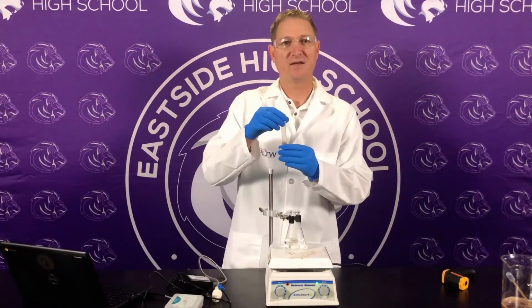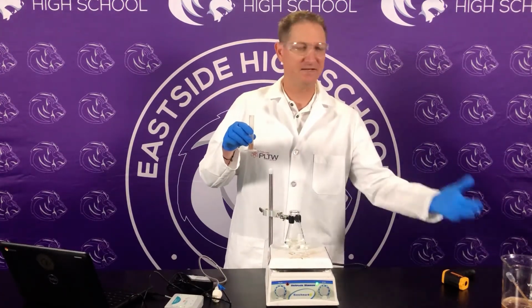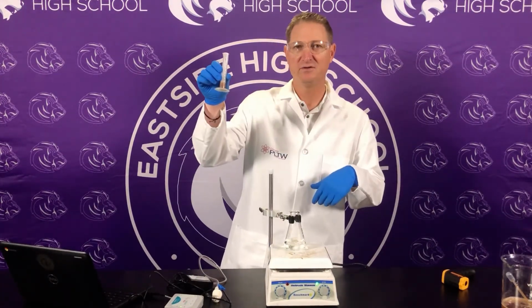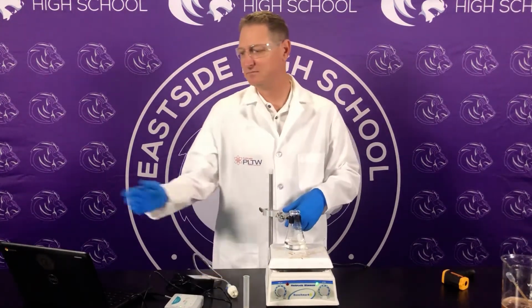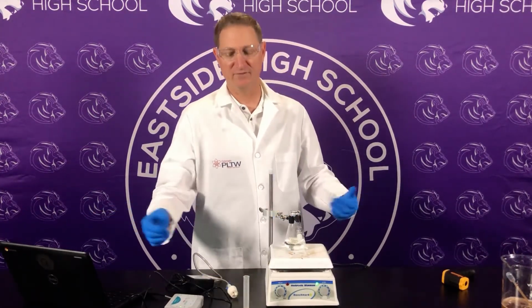This is that catalase that I used in the same lab, same batch, same everything. 2 mLs, it's gonna go in. As soon as it goes in, secure the lid, press collect, and wait for 200 seconds.